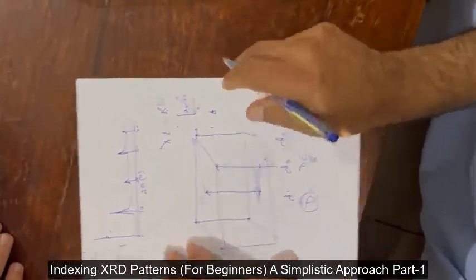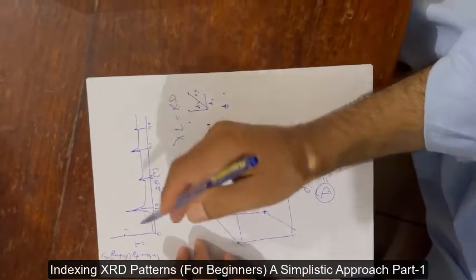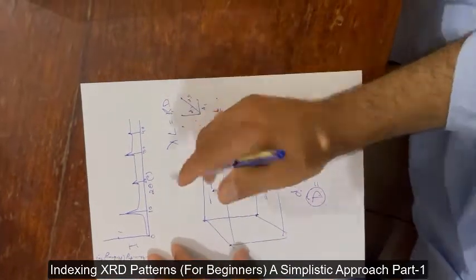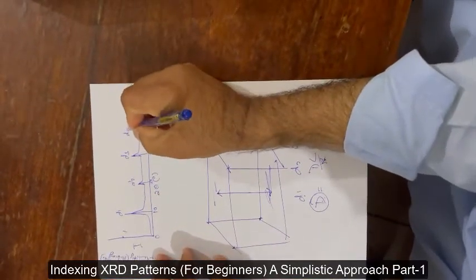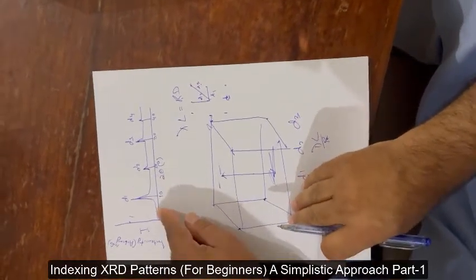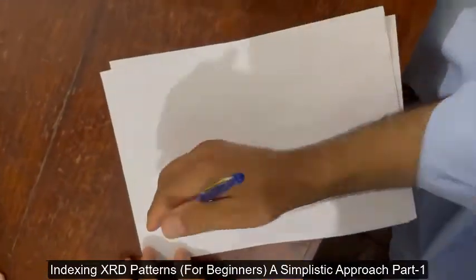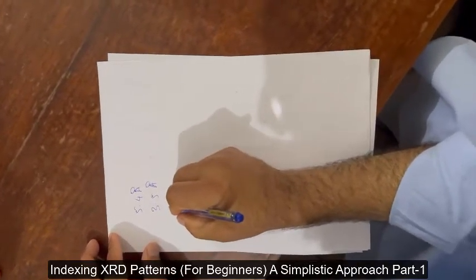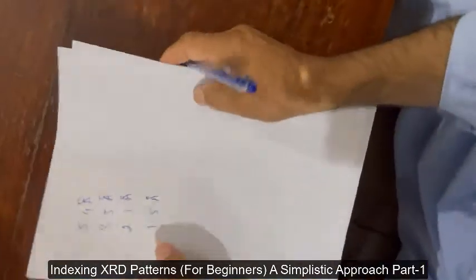In reciprocal space you are reciprocating things, so larger angles mean smaller d-values and smaller angles mean higher d-values. Higher d-values mean the interplanar spacings are farther apart. Nowadays software is available and gives you d1, d2, d3, d4 from your XRD machine — for example, 5.4 Å, 3.5 Å, 2.1 Å, and 1.5 Å.